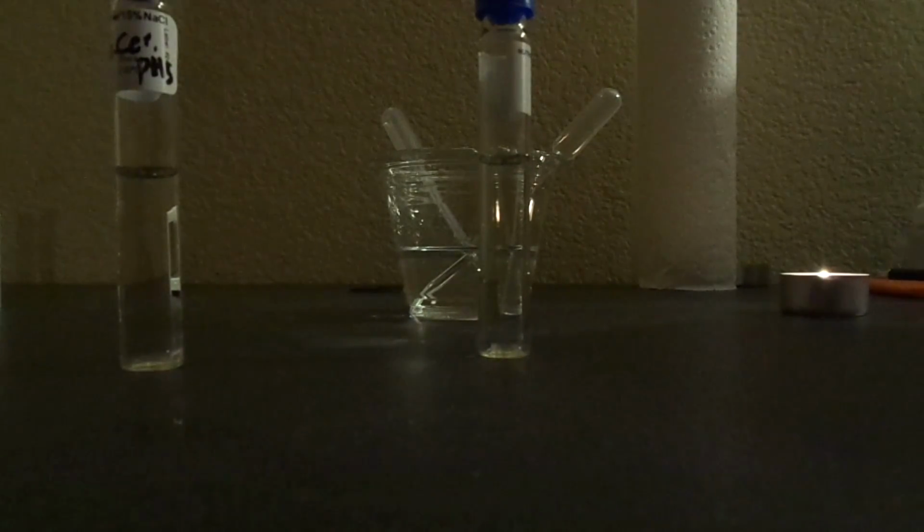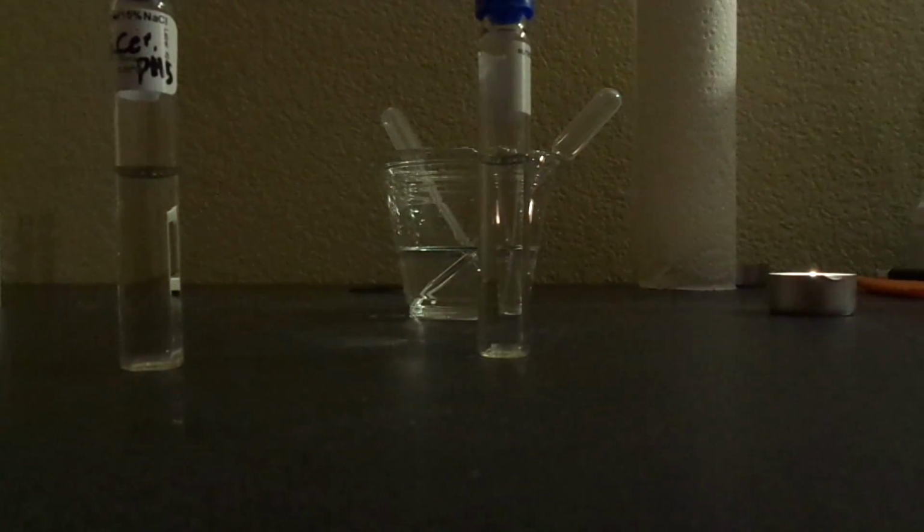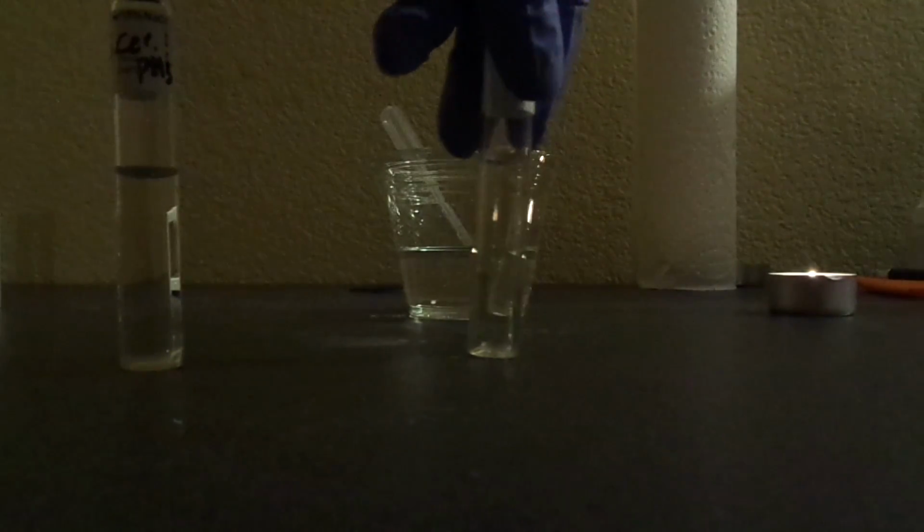Also using sterile techniques, especially on the cultures here, the active cultures. We don't want to get those contaminated, because then we won't know what we're testing with. Okay, so we're going to go ahead and take that and match the microbe. This one I grabbed is the S. epidermidis. So we're going to match it with that tube, of course.